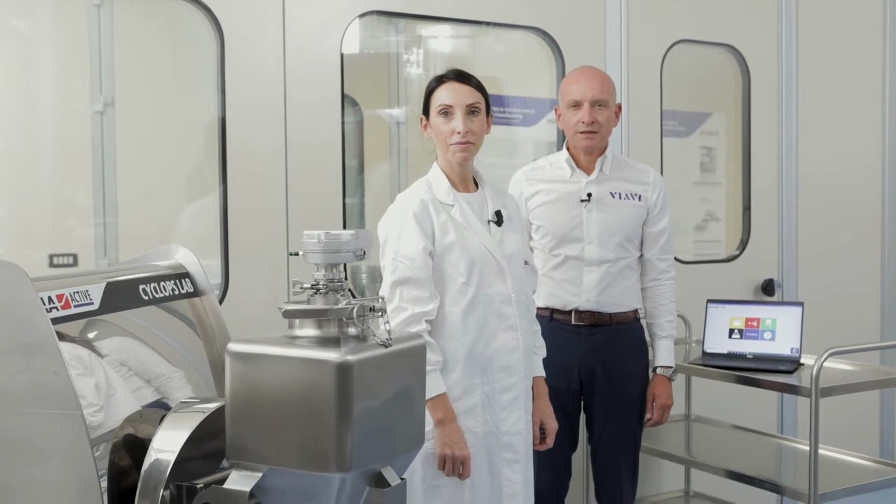I'm right, Emiliano? Yes, Jussi, sure, you are right, and not only, because the traditional way to control a blending is prescribed by the ICH guideline. In this document, it's clearly written that you need to take 10 samples with a sample thief and bring them back to the laboratory where you will perform a UV-visible or an HPLC measurement. This is clearly not an online approach because the analysis has to be done only once the blender is stopped.